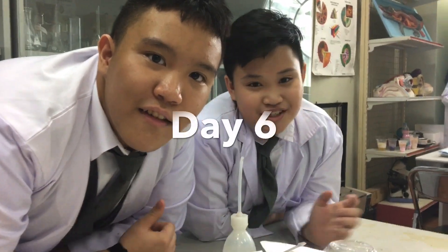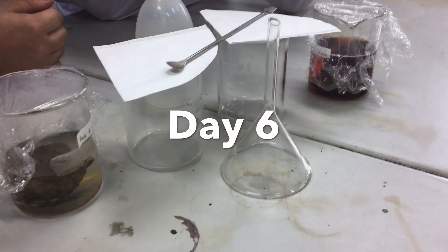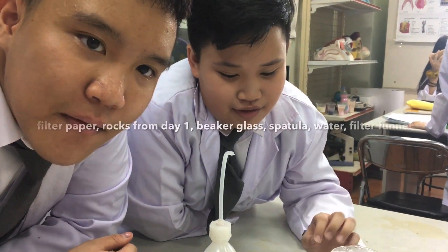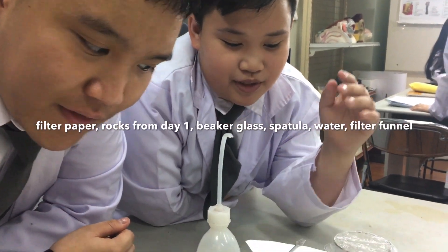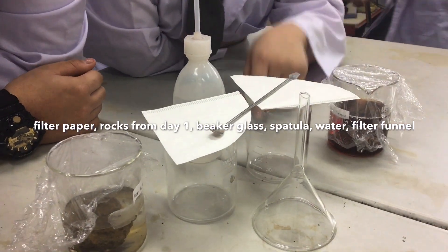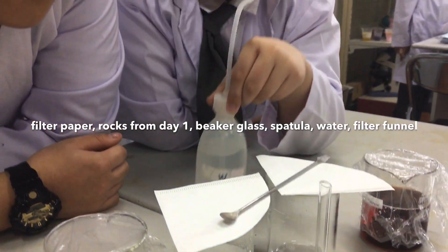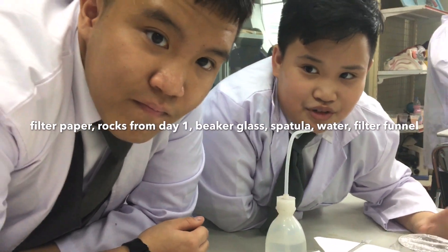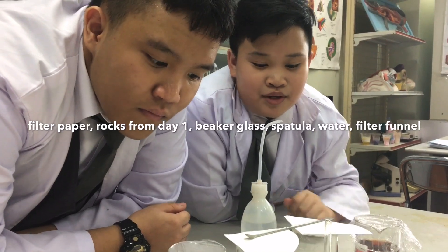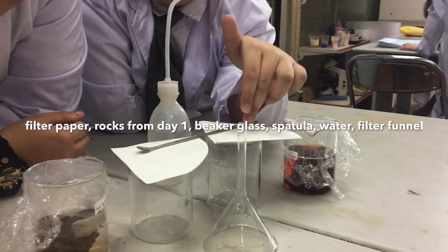Hi guys, this is day six. Today we're going to filter out the minerals from this acid water right here, so we can observe the minerals that we got. We're using two filter papers because we're using two rocks. We've also got two beaker glasses, one filter funnel, and some water to wash off the rock afterwards, and a spatula for observing the minerals.